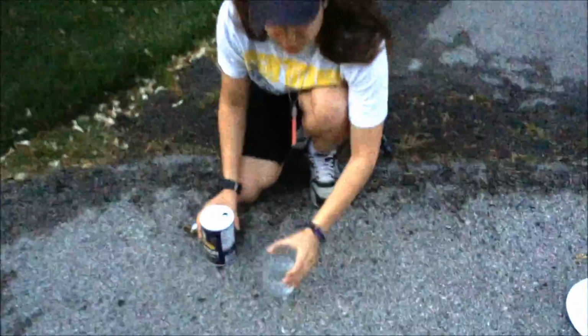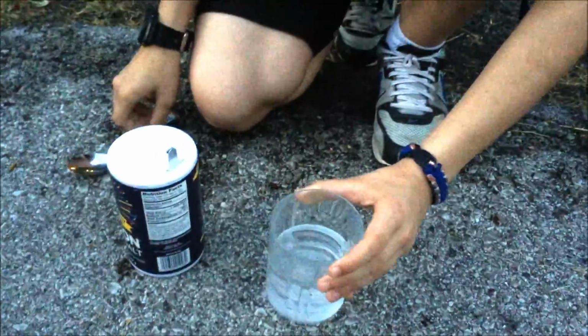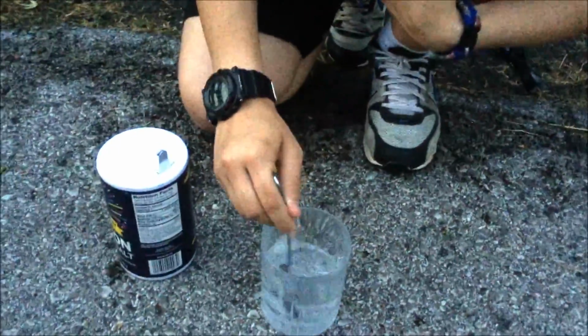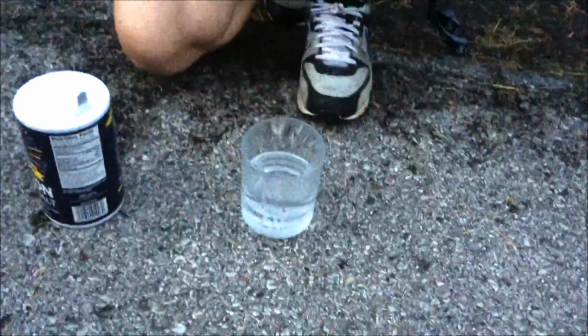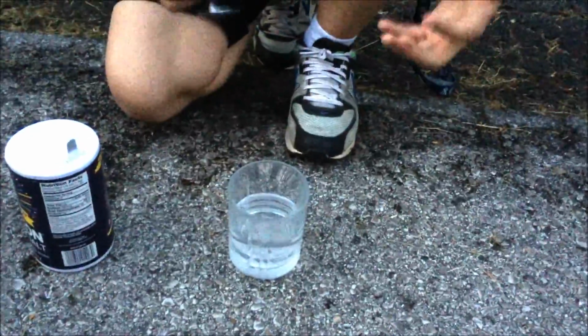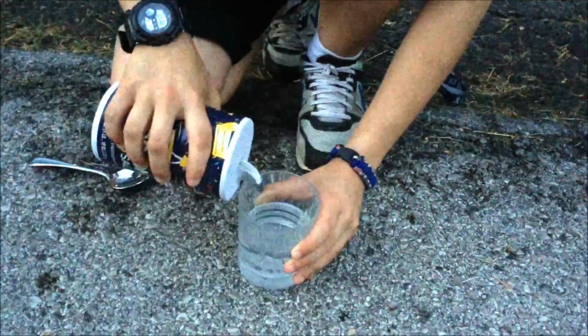Okay, we're going to start off with different types of solutions. You have unsaturated, saturated, and supersaturated. Right here I have a glass of water and some salt, and I'll put a little bit of salt in here. There, and I'm going to mix that up. Now, you really can't tell that there's any salt in here whatsoever, and that's an unsaturated solution, which means a solution in which the solvent is capable of dissolving more solute, which means I can add more salt, which I'm going to do.